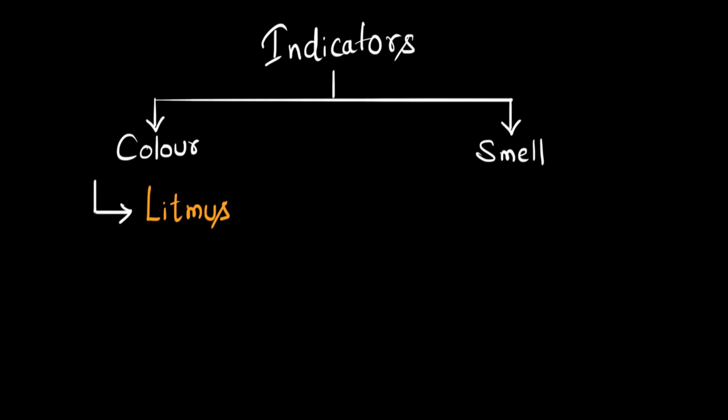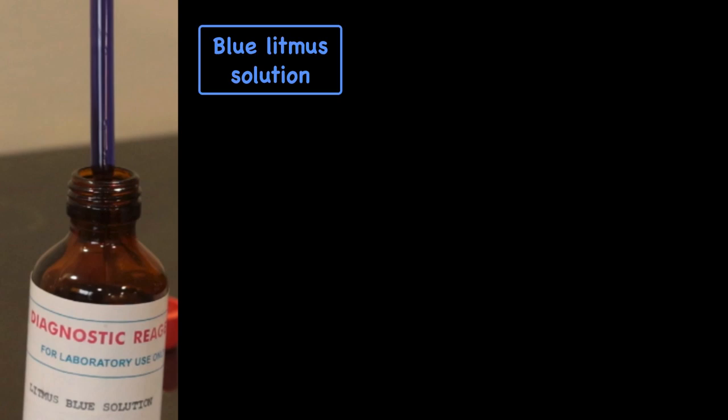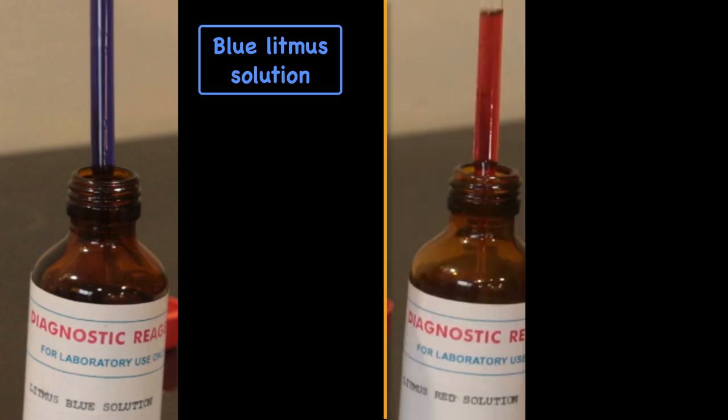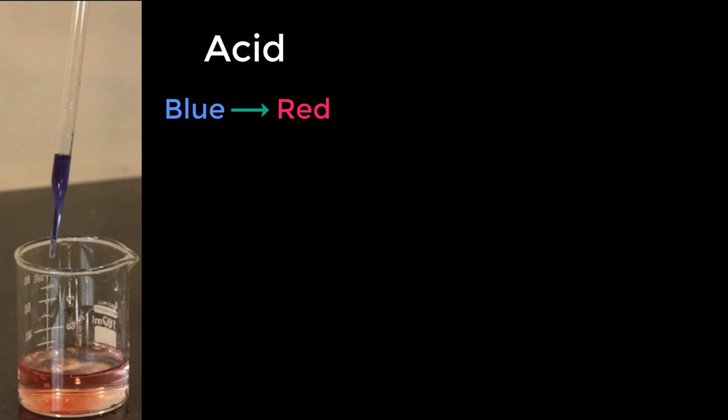Generally you would find litmus solution available in two colors: blue, called blue litmus solution, and red, called red litmus solution. Here I have an acid in a container and I'm going to add a blue litmus solution to it. You can see that slowly the color is changing to red. This means that whenever an acid comes in contact with a blue litmus solution, the color changes to red — in case of an acid, the color changes from blue to red.